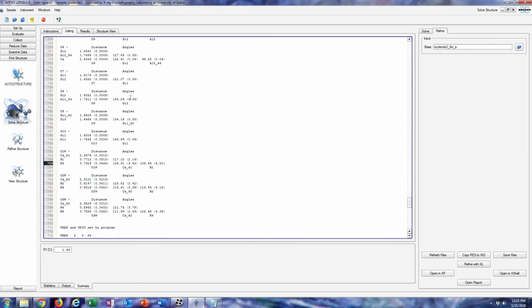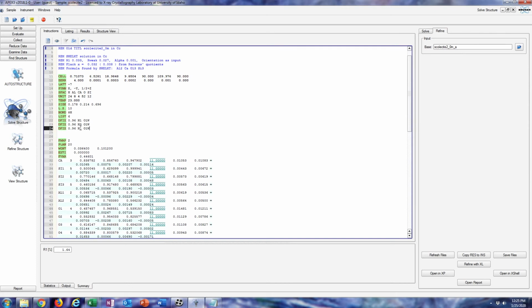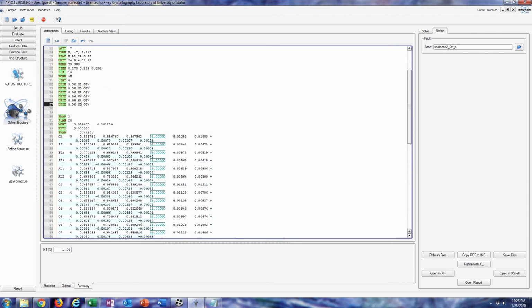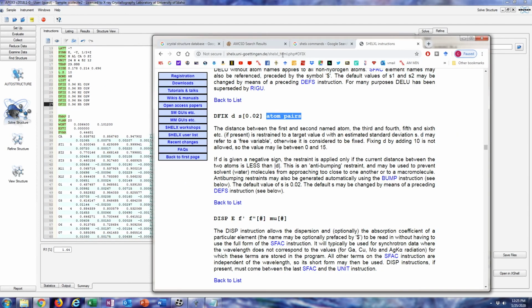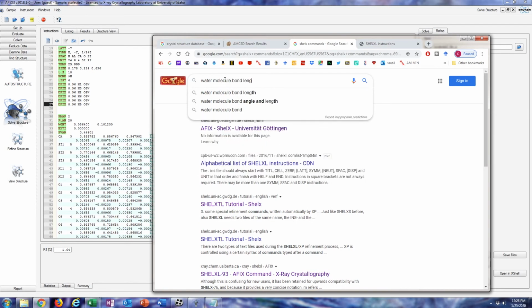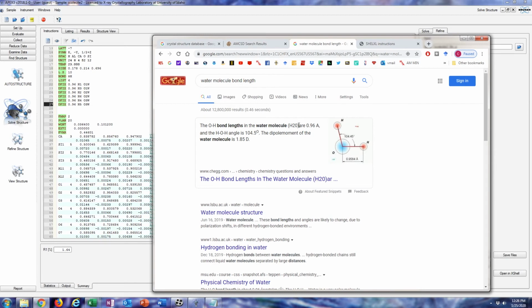And this is probably not going to make any difference in our R value, really. It's just to make sure that our model is correct. And it's impressive enough that we can even see these hydrogens with X-ray diffraction, especially at room temperature where things are moving around. But I think this is a really good starting point for trying to perform structural refinements on a zeolite, something that's reasonably well structured, like scolecite. Water molecule bond length, yep, 0.96.